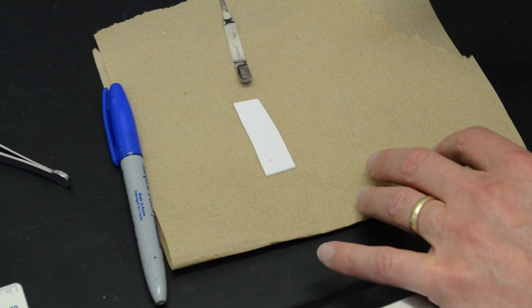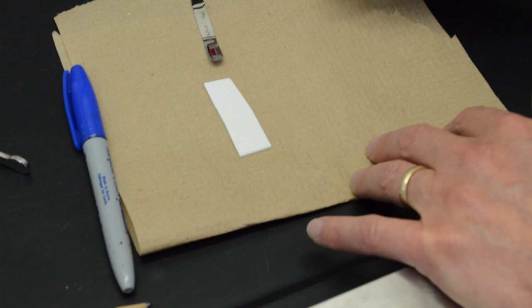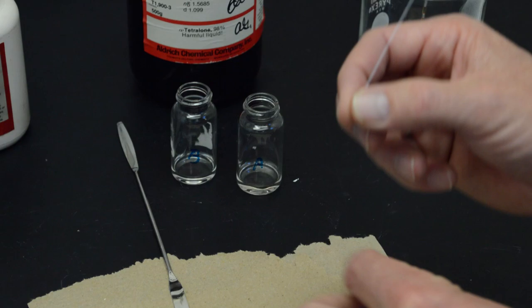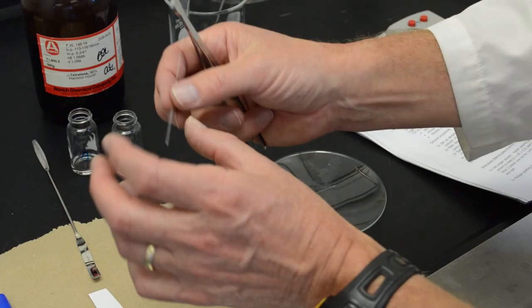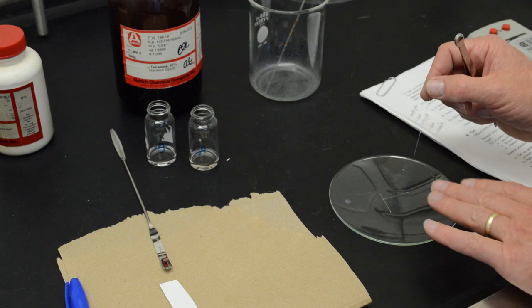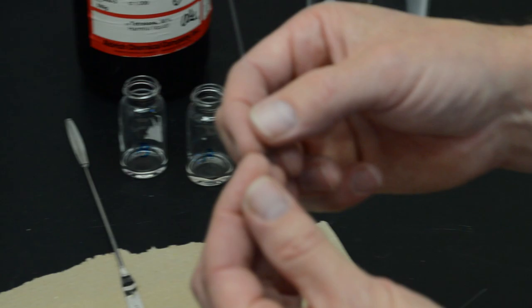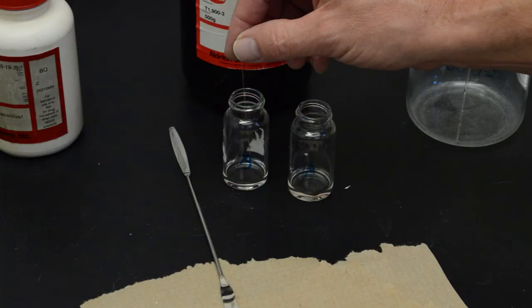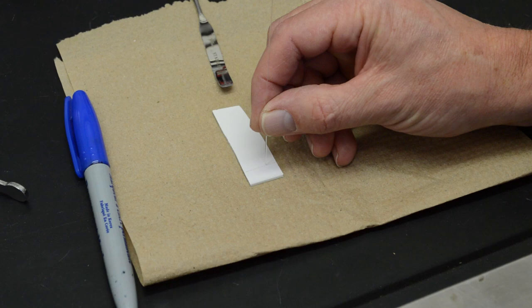The rest of the solvent from the TLC plate you can run out onto paper. Now, before we use the same pipette in sample B, we break off the little bit that was at the bottom. When we break the tip off, so that we have a clean pipette to go into the next sample, we will put the broken piece onto a watch glass for disposal into the broken glass. And be careful not to poke it into our finger. And we will get a sample of the second sample B in the spotter and spot that just to the right of the first bit on the line.